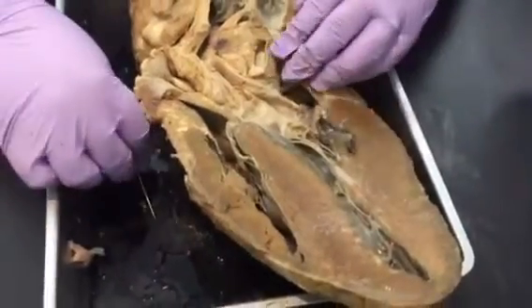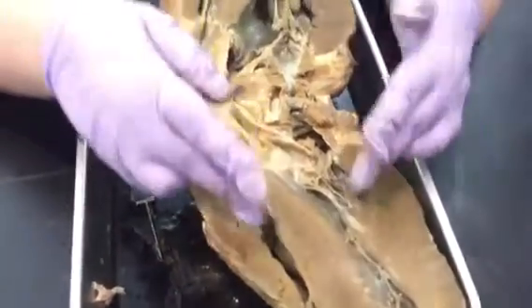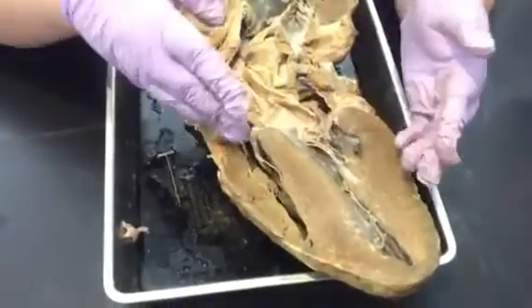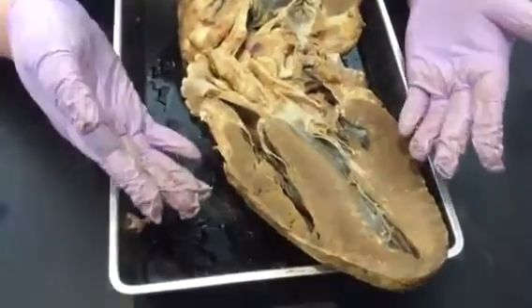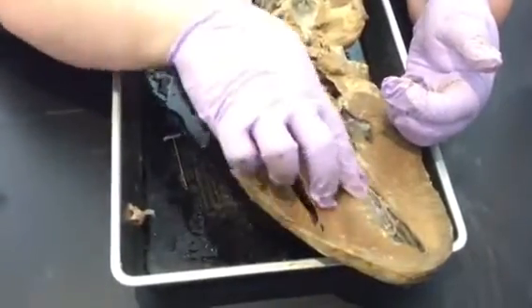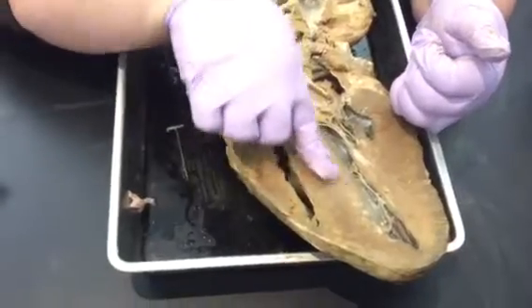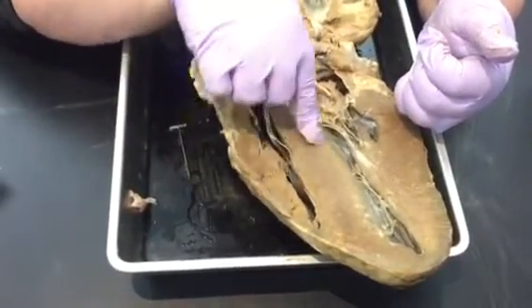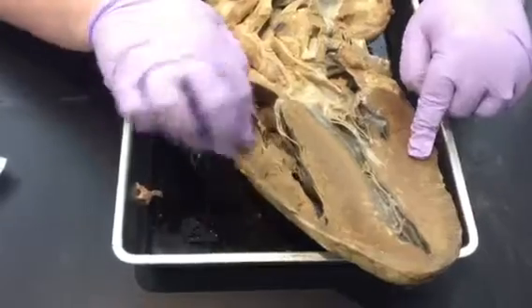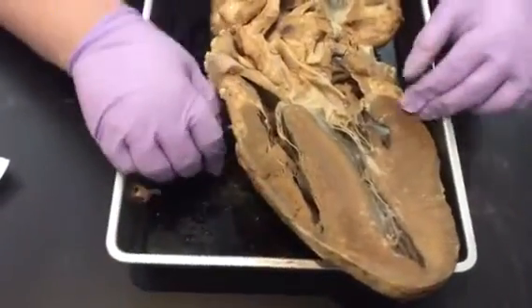From inside here, between the ventricles, we have the interventricular septum. A septum divides two chambers, so that's your interventricular septum. It's made of myocardium, but if I'm pointing to this, I'm asking for the interventricular septum. I'll ask for the myocardium out here somewhere along the wall.